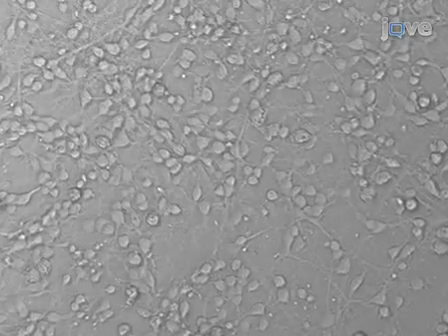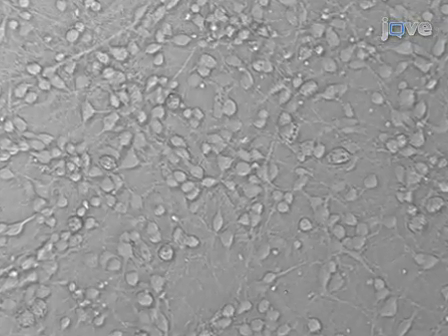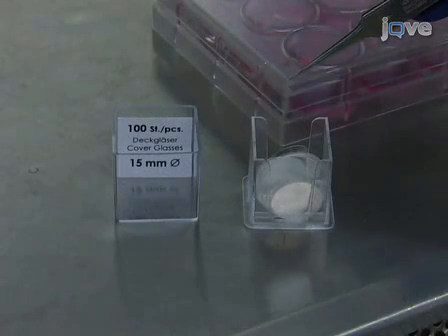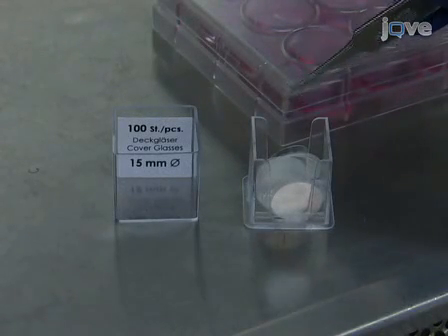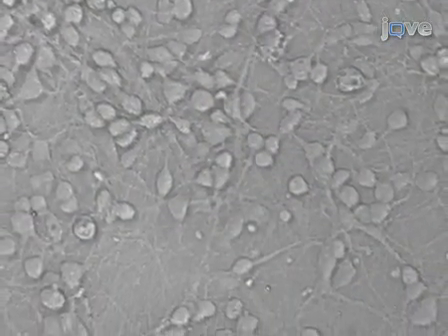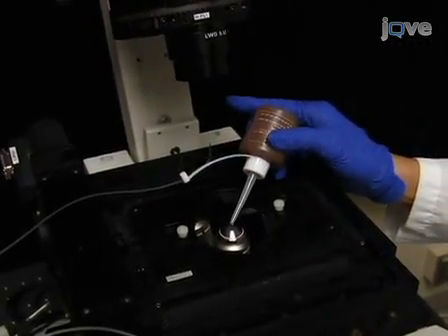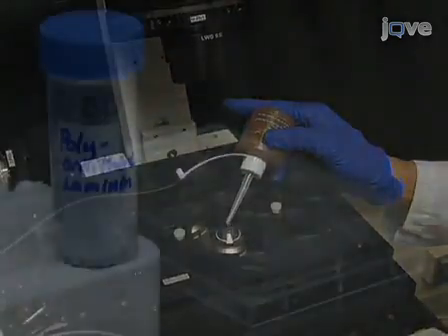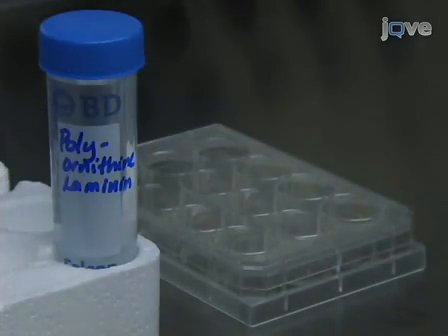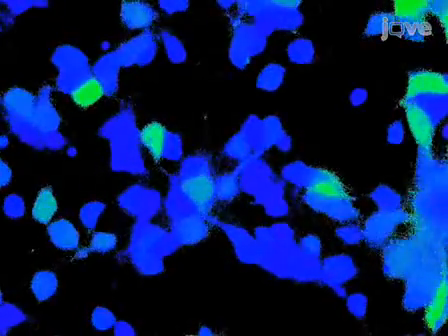The cortical neurons used for this calcium imaging procedure can be grown using established techniques, but should be plated on 15 millimeter number one glass coverslips, because low fluorescence imaging of live cells is best achieved with high numerical aperture objectives that require oil. In addition, we pre-coat the glass coverslips with polyornithine and laminin in order to prevent the cells from detaching or moving during imaging experiments.